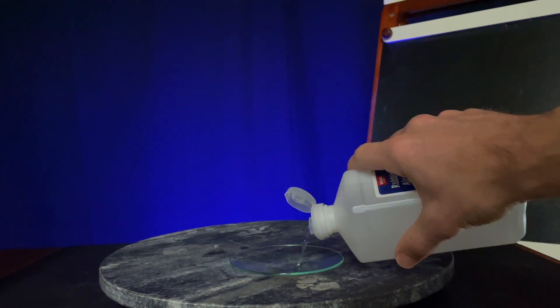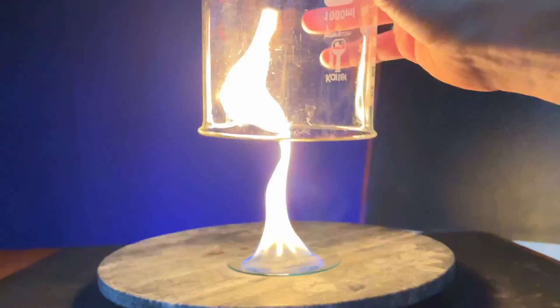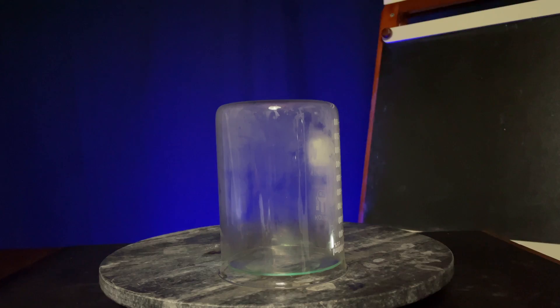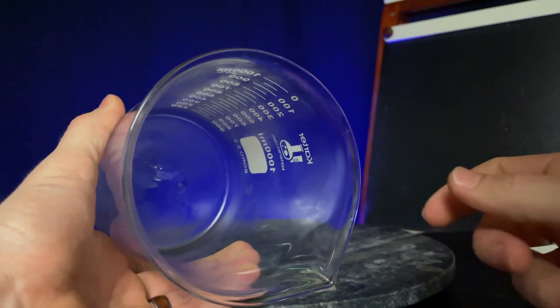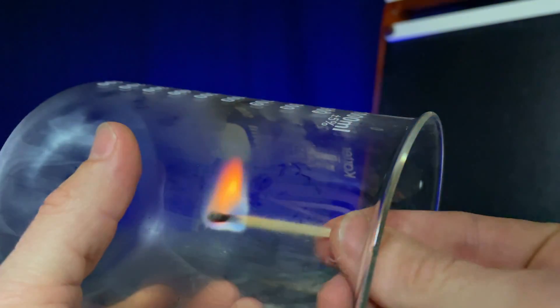Fill the dish and relight the alcohol. Now let's cover the alcohol with the jar. What do you notice happens to the jar? Name two potential products that could make the jar foggy. When I feel the fog with my finger, it's quite damp, like a mirror after a long shower. But the dampness does not appear to be flammable. Does that decrease the likelihood of either of your guesses? We'll break that down in a moment.